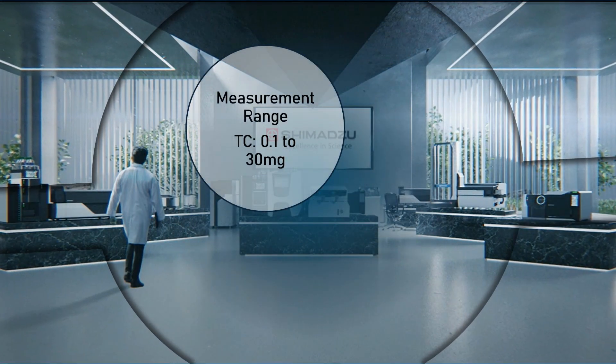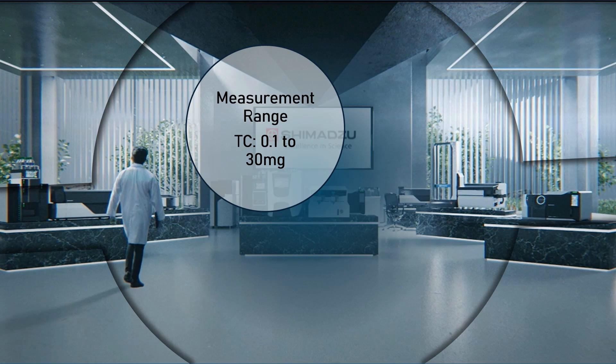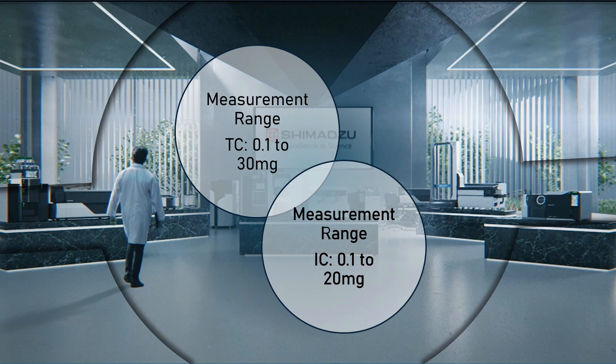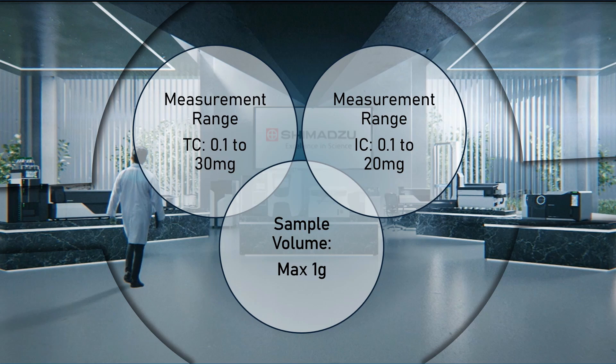The SSM measurement range for TC is from 0.1 mg to 30 mg carbon content, while for IC it is 0.1 mg to 20 mg carbon content. The maximum sample volume that can be measured by the SSM is up to 1 g.